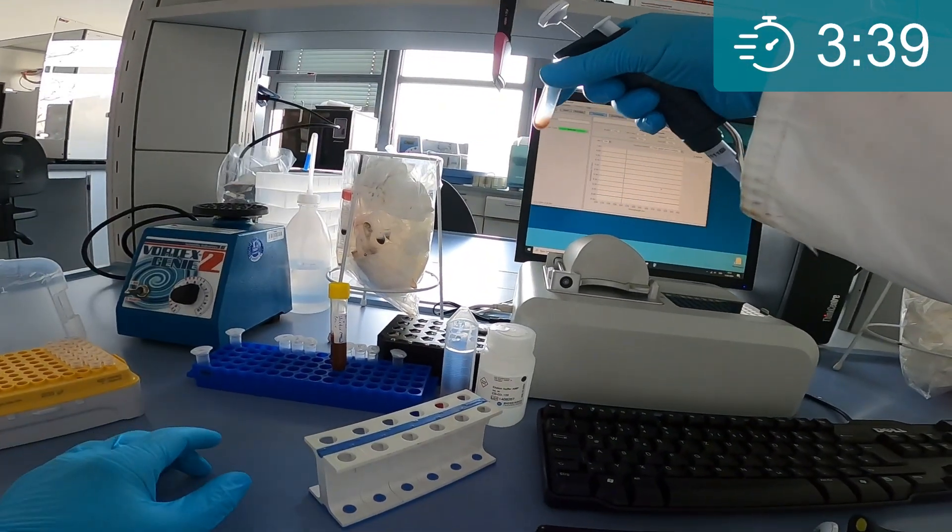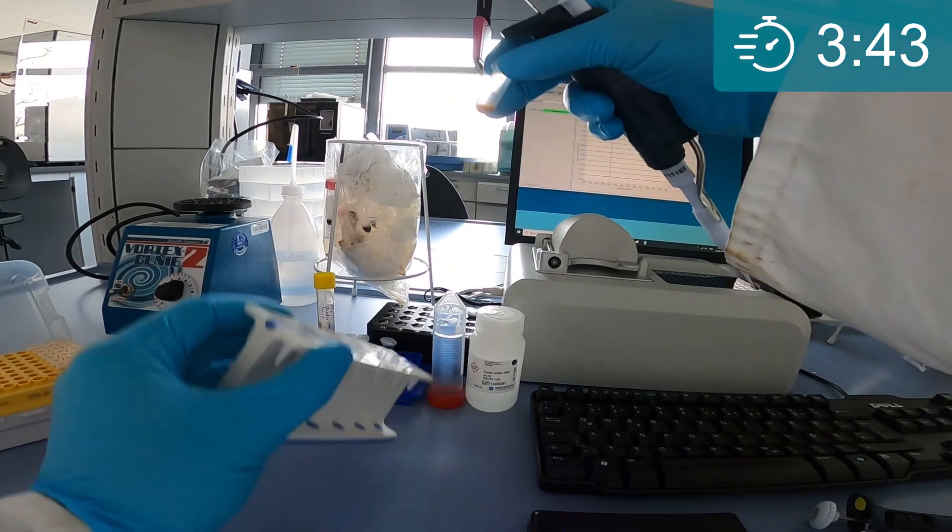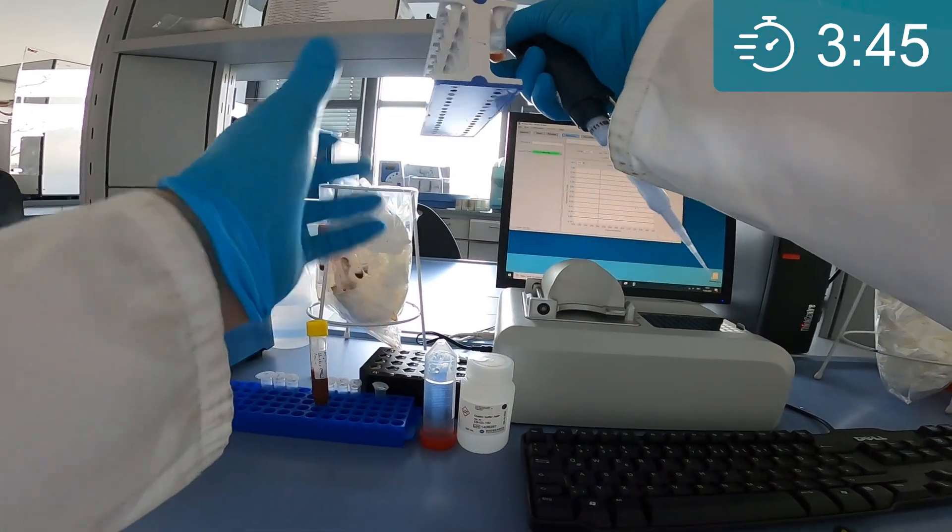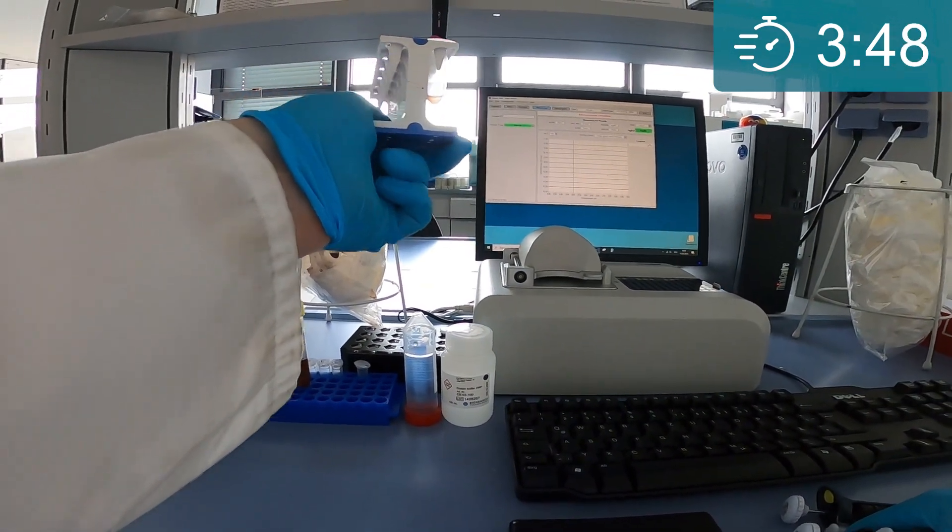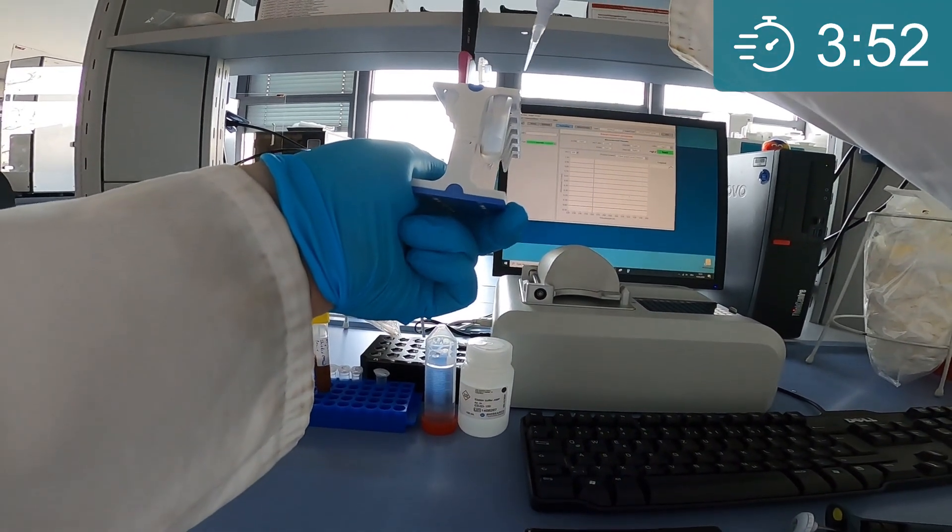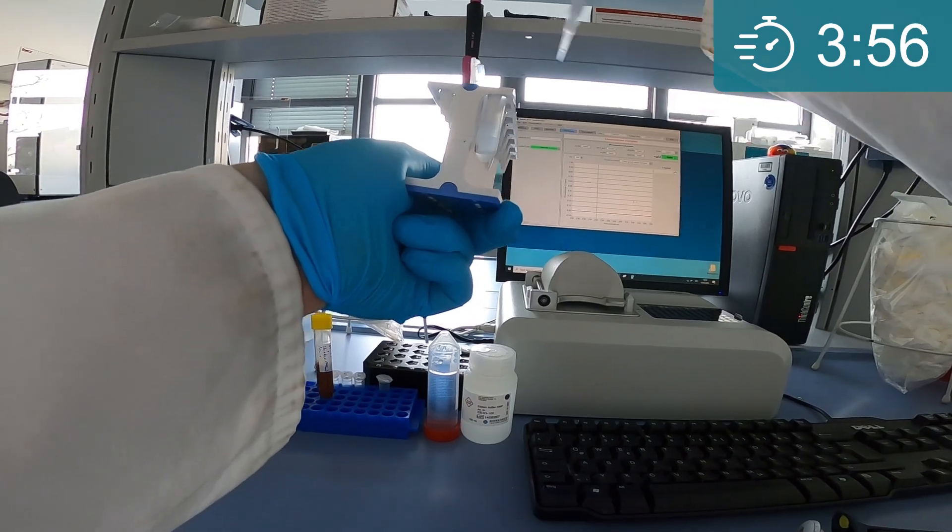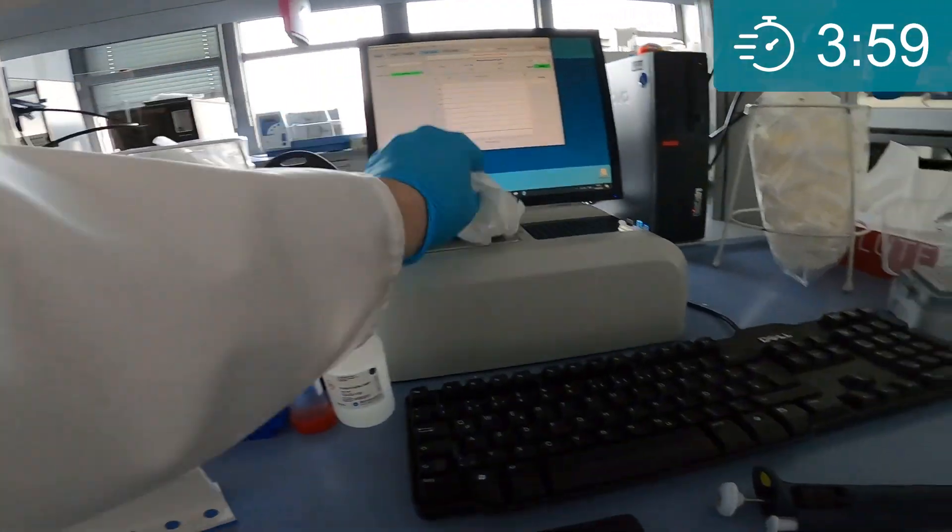Before analyzing your DNA, you should separate out the beads on a magnet, as they might interfere with the downstream analysis. You can either transfer the DNA eluate into a new tube, or you can leave the beads inside the eluate in this case.